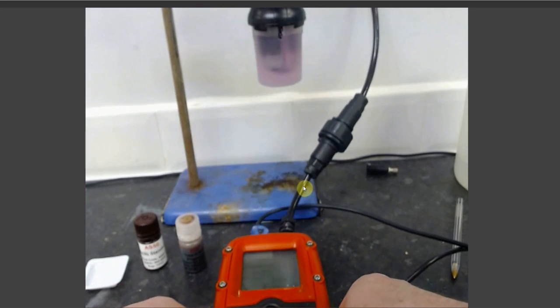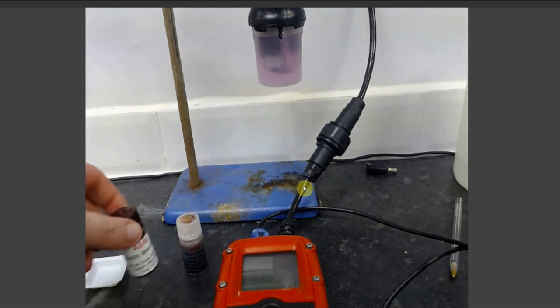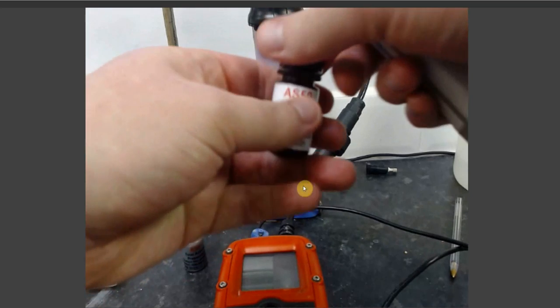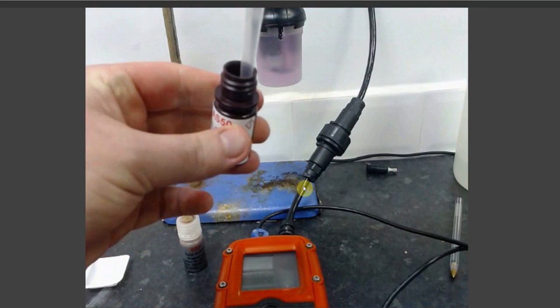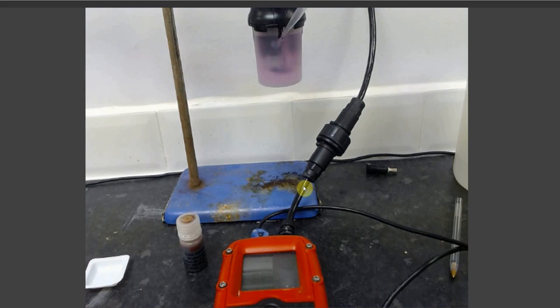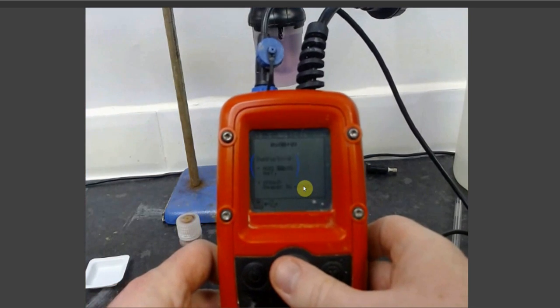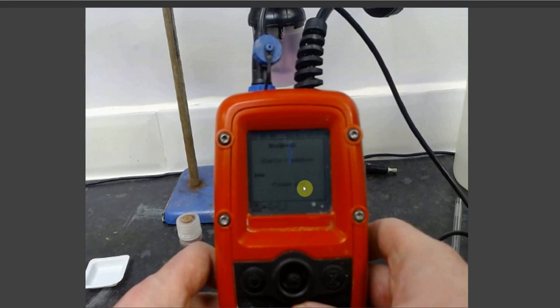To add 20 parts per billion to a 70 ml sample, take your AS50 standard and your pipette and pipette 280 microliters of your AS50 standard into your sample. Once this is done, go back to your Metalyser unit and press select on the appropriate concentration increase.